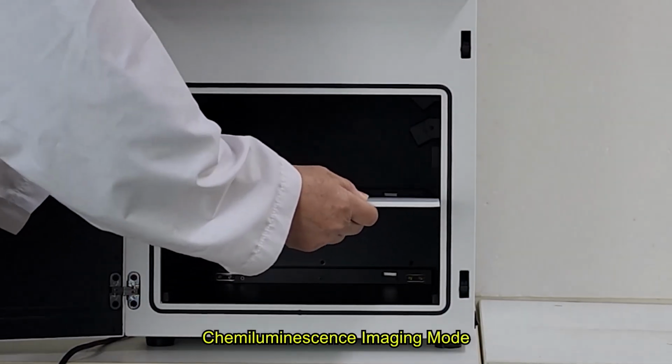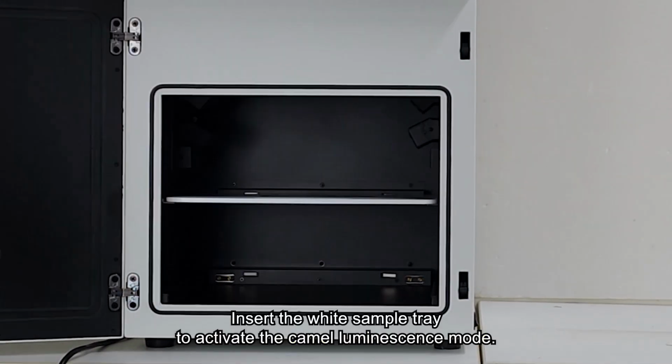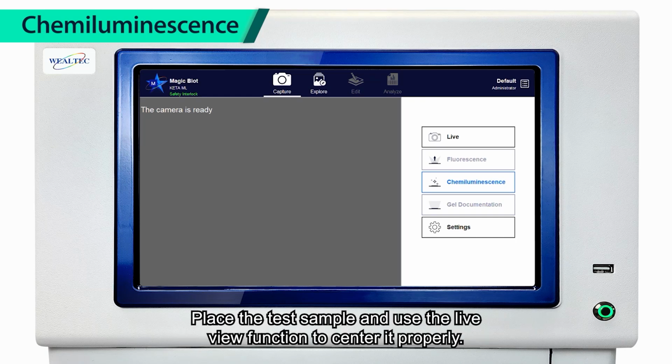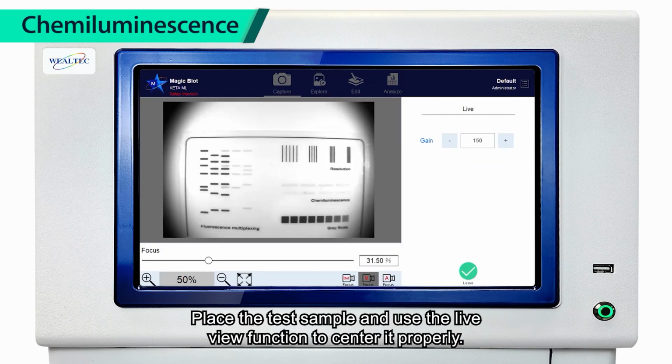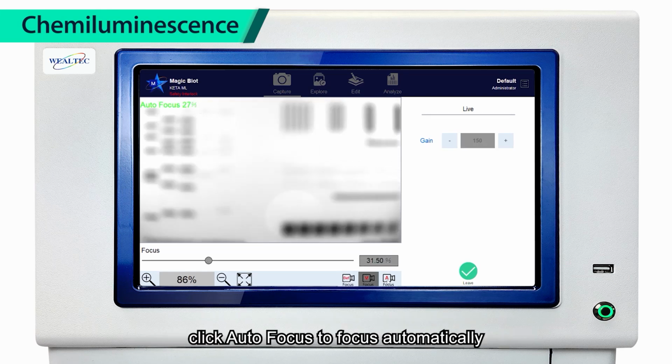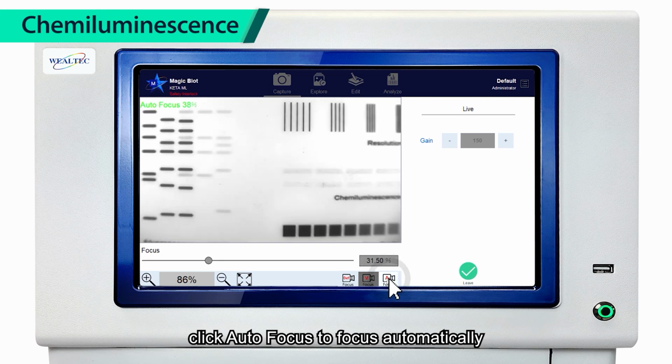Chemiluminescence imaging mode. Insert the white sample tray to activate the chemiluminescence mode. Place the test sample and use the Live View function to center it properly. Since KETA MLX2 supports fully automated imaging, click Autofocus to focus automatically.